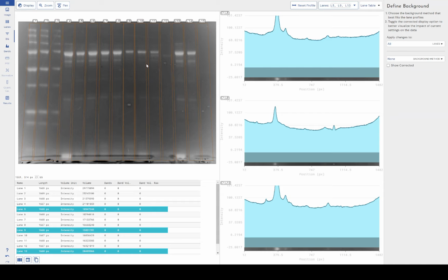Phoretix 1D allows you to select both the technique and the strength of that technique on a lane-by-lane basis. And in fact, if I was working with a multi-channel image, we also facilitate the ability to have different background correction parameters and techniques on a channel by channel basis. So if you have a channel of your image that has higher non-specific binding than another channel, you can accommodate for that. You can still get good data out by using our software.